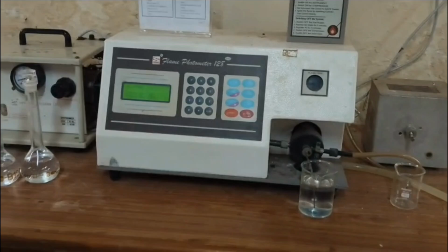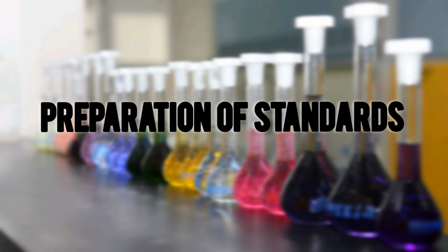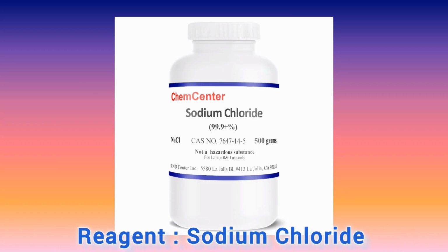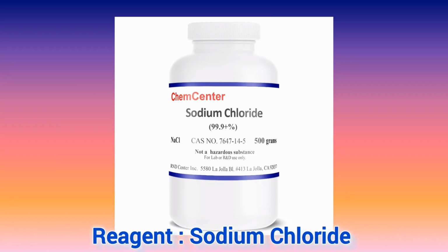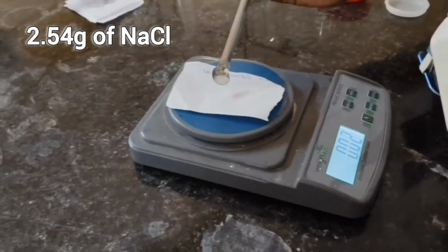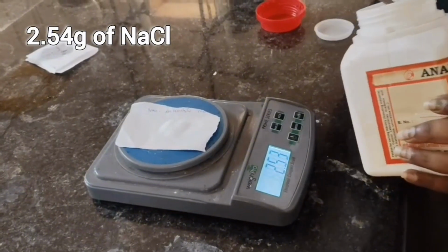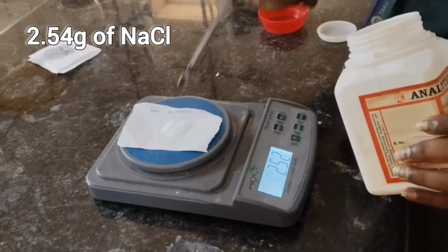Let us learn about how to estimate sodium in a water sample using flame photometry. First of all, the standard solution should be prepared. Sodium chloride is the analytical reagent used in this experiment. Weigh 2.54 gram of sodium chloride to make 1000 ppm of stock solution.